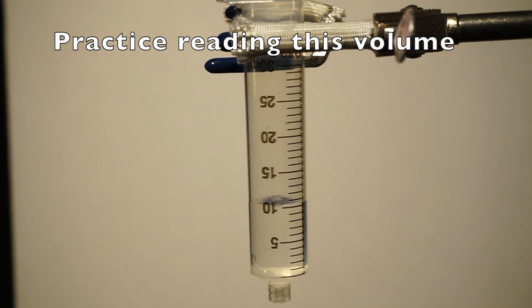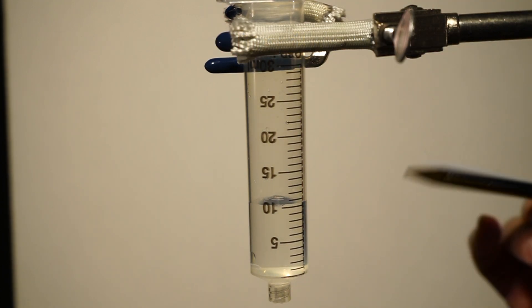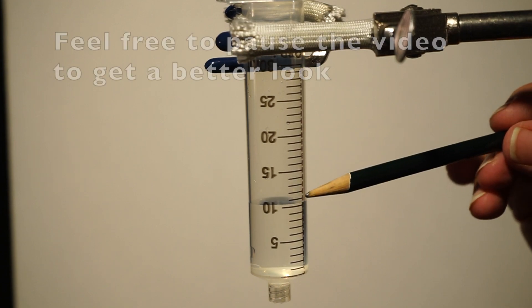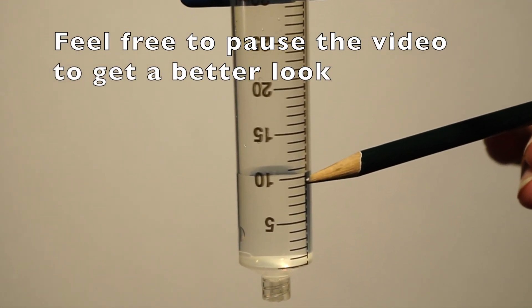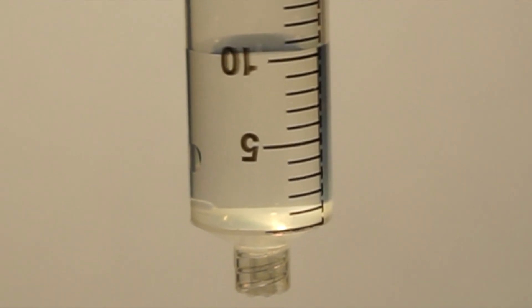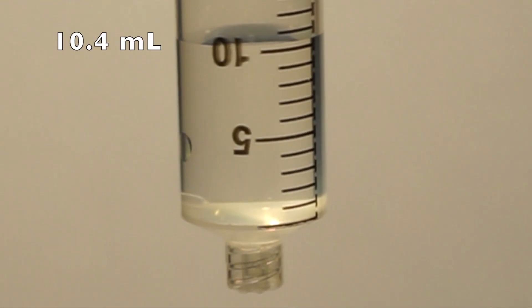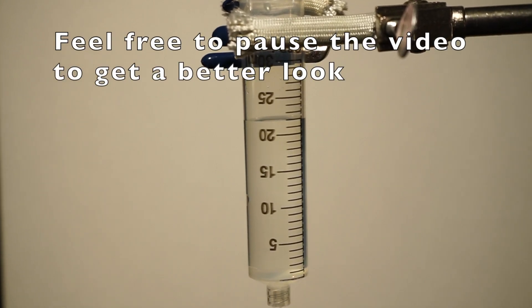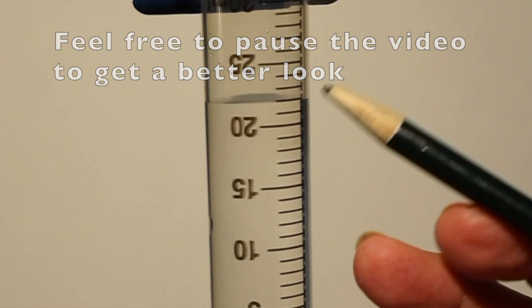Practice reading these two examples. What is the volume in this case? It is 10.4 milliliters. What about in this case? It is 21.9 milliliters.